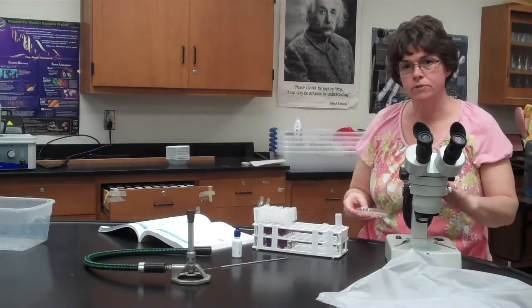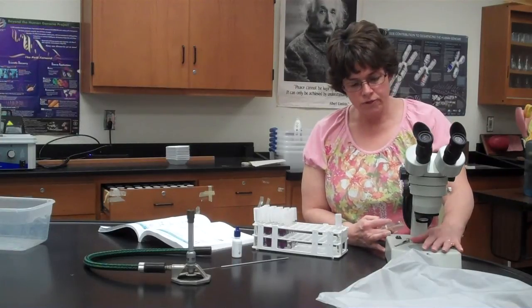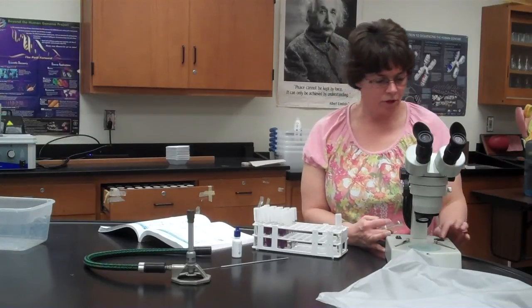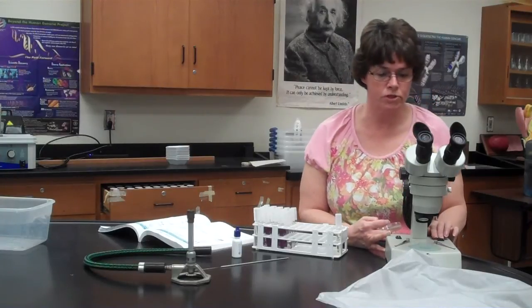And then when in the lab manual it says to use a hand lens, we're going to use the dissecting scope. And I mentioned in the yeast lab that I'd show you what the dissecting scope is. So for this particular microscope, it's very, very simple. You would plug it in like you always would. There are 2 light switches. There's the main switch, and then there's these 2 switches over here.